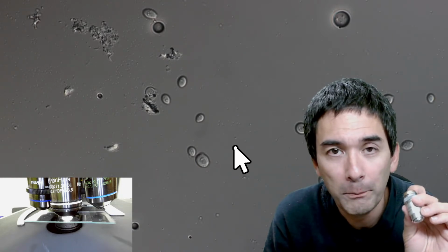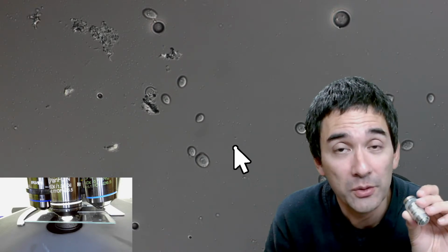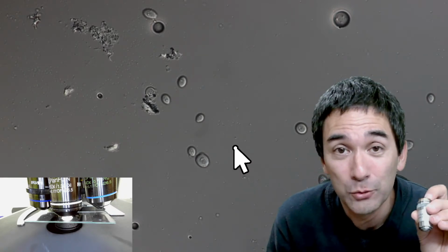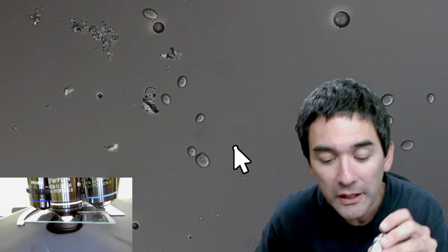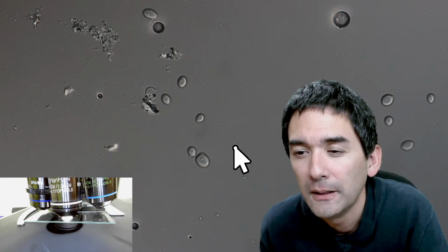Some companies in Europe and in the United States don't sell those objectives, but I buy them directly from AliExpress, directly from China. You get them quite cheaply. It takes a couple of weeks for them to arrive, but the companies that are making those sell the objectives directly over AliExpress. So that's actually something I would recommend.